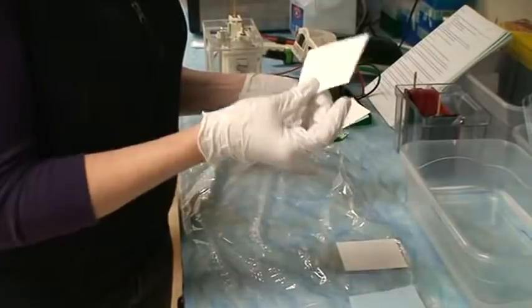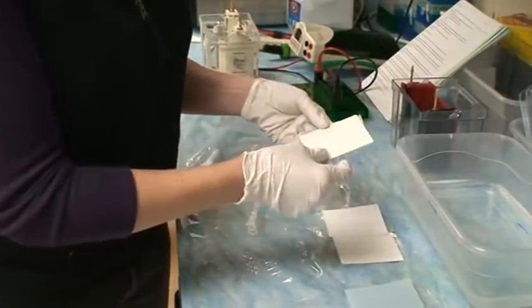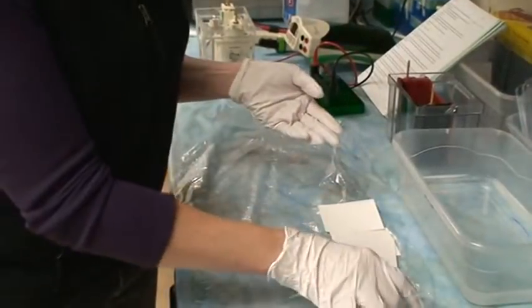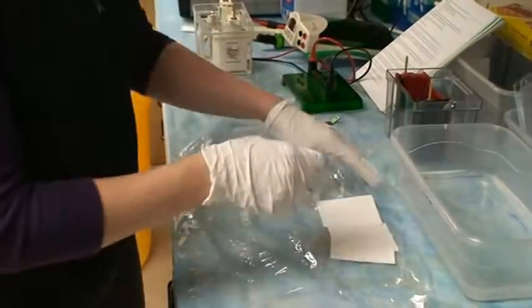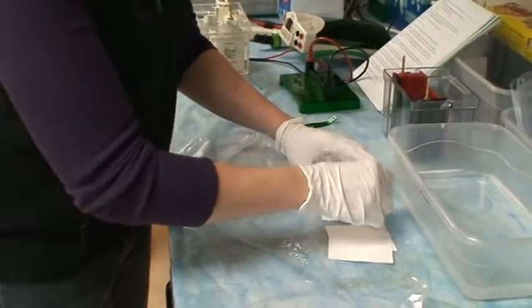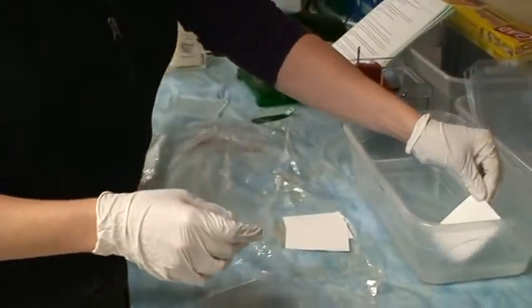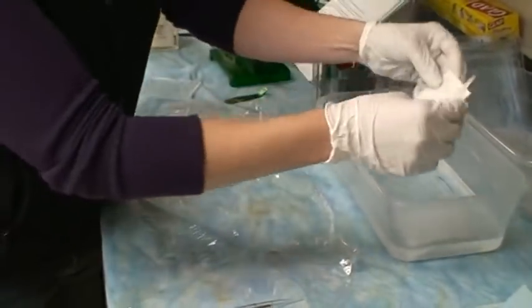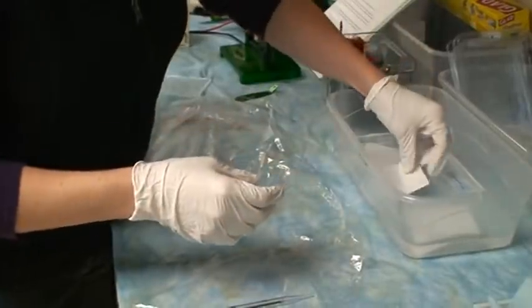A thin, smooth piece of nitrocellulose membrane and another piece of filter paper. The second piece of blue paper you're not going to use, so you can get rid of those. You can go ahead and put each of these filters and the membrane into your dish to get them soaking in the transfer buffer.